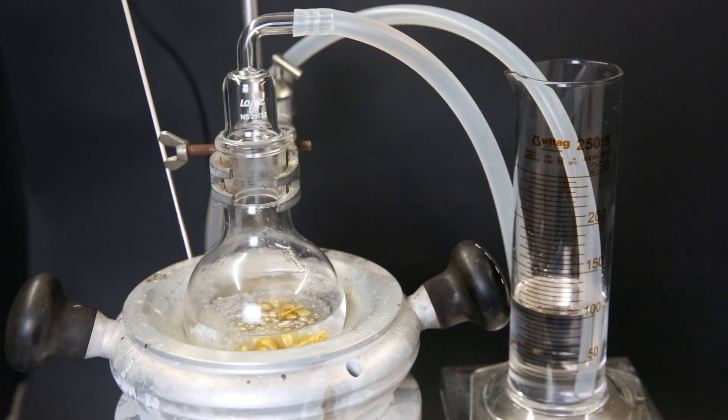To start the reaction I heat the mixture to 200°C and start stirring. Unfortunately the weight of the magnesium and sodium hydroxide is blocking the stir bar from moving, so I tried to help it a little.